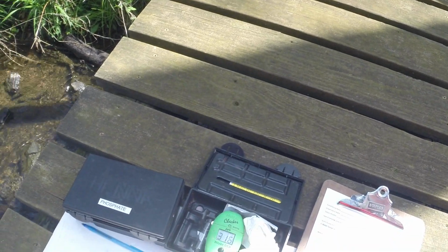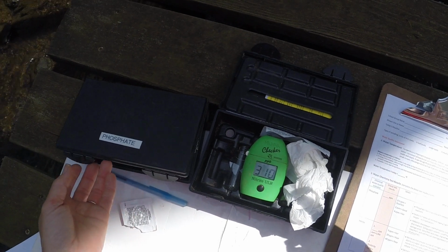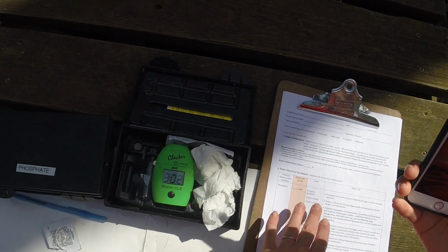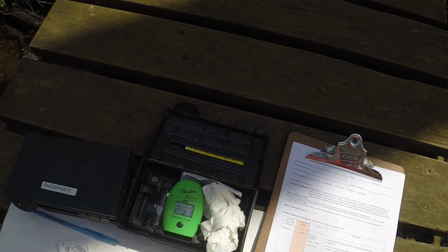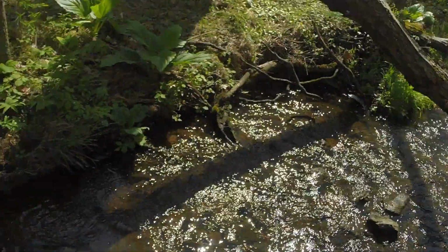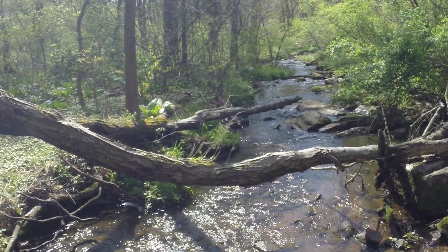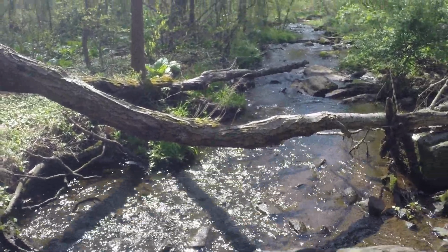Now, what these Hanna checkers do, with a phosphate, is check in parts per million. And on the reading, 0 to 1 parts per million is excellent. 2 parts per million is good. 4 parts per million is fair. So you have to think about the number. We obviously want a low number. And it's a million parts of water. So that's a lot of parts of water. If the reading comes up as like 50 or 100 parts per million, would that be good? No, and I'm also being extreme.